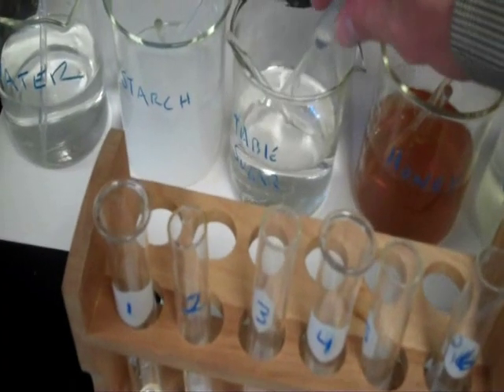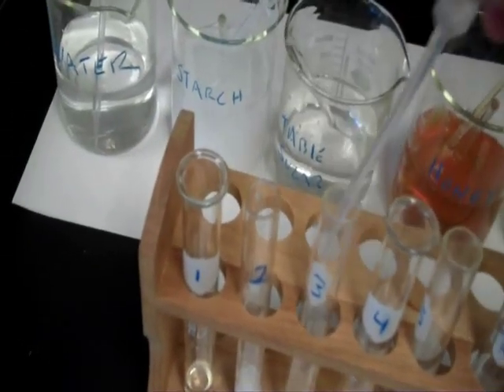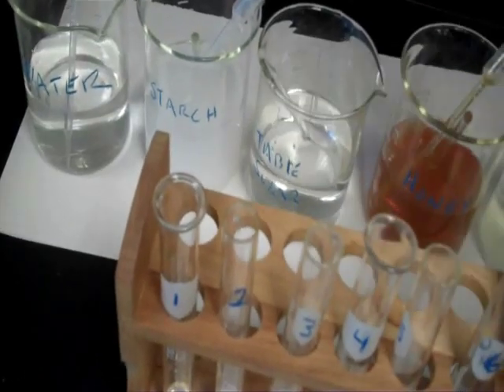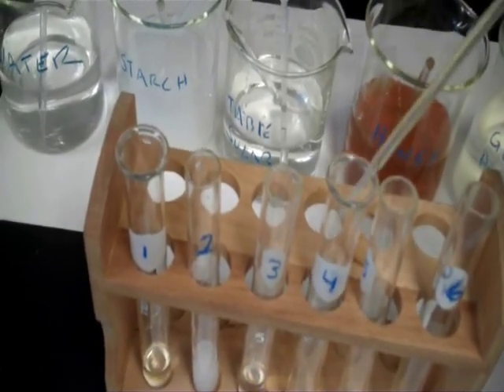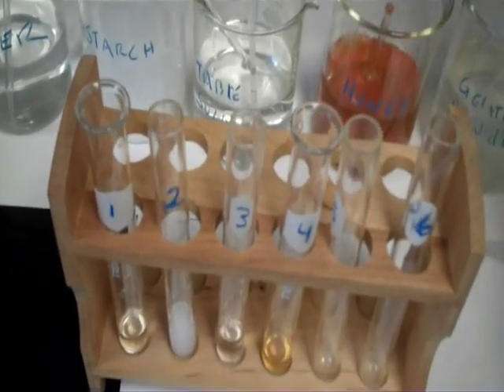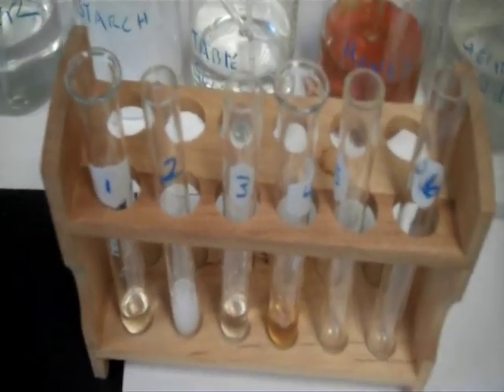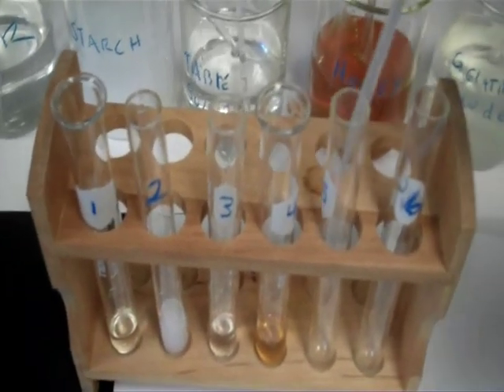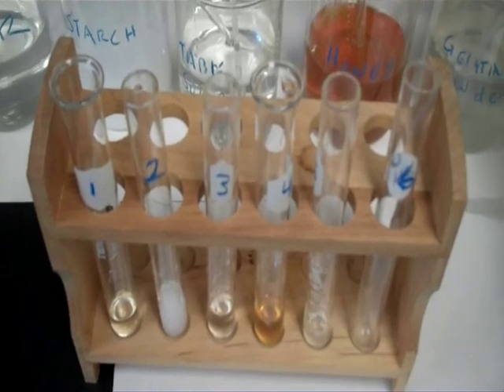To start the Benedict's test, we'll first fill our test tubes with some of our simple solutions. We're going to put water in test tube one, cornstarch in test tube two, table sugar (sucrose) in test tube three, honey (glucose) in test tube four, gelatin powder in test tube five, and egg white into test tube six.